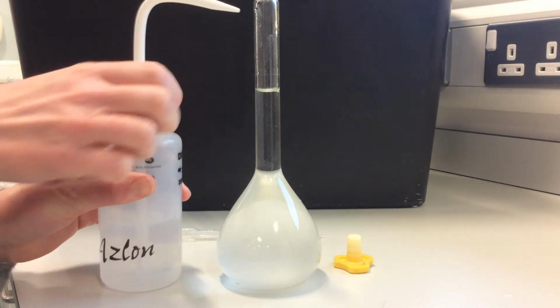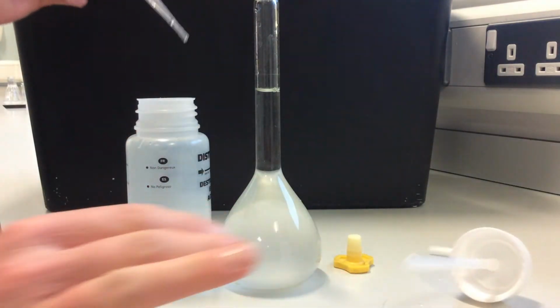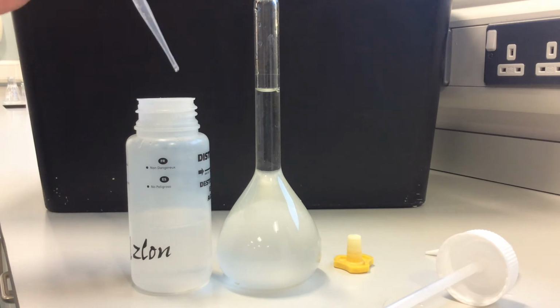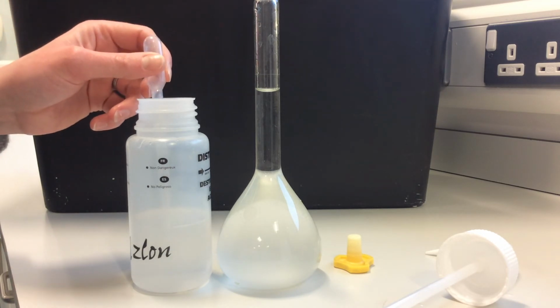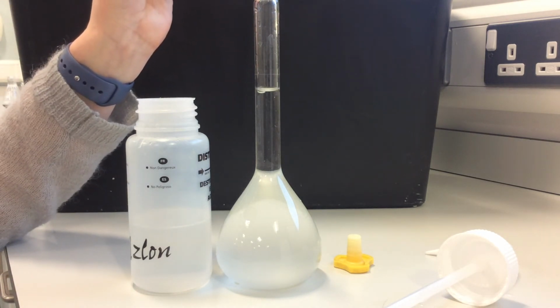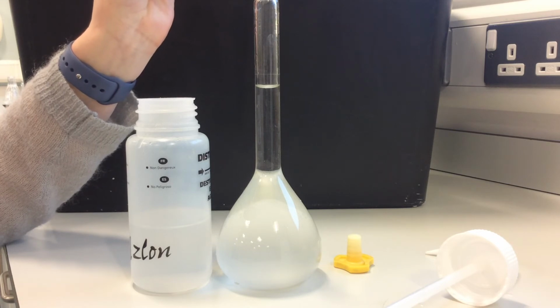So what I want to do now is take off this lid, and add it just using a dropping pipette. You may notice this is a wee bit wet. I'm going to just squeeze a little bit out onto some paper towel there. I just rinsed it through with deionized water just in case it had been used with anything else. So I rinsed it a few times with deionized water. So that's absolutely fine. It's not containing any other chemical. So what I want to do is get down at eye level and just add drop-wise, allowing the water to flow in from the edges.